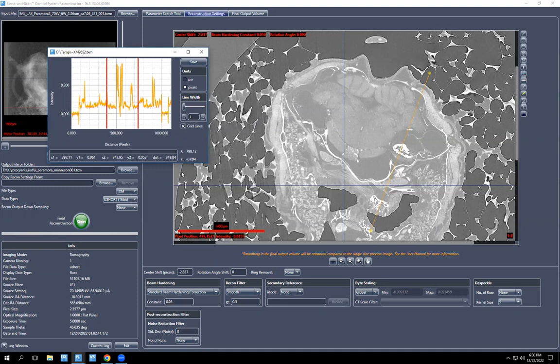So what you want to do is your maximum value should be this number plus a tiny bit of wiggle room, because if you make it this number, that's your whitest white, and the otolith will be completely white with no gray values. And you don't really want that. You want a little bit past it. Earlier for the first segment, I picked 0.41 after playing with it a bunch of times and seeing what looked best. And 0 you can use for the minimum, although a slightly negative number sometimes looks a little bit better, but in this case it looked fine to use 0.